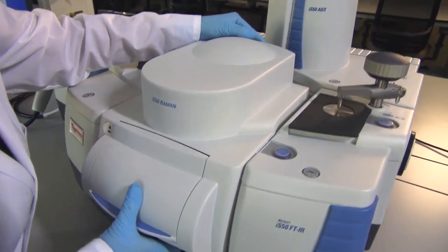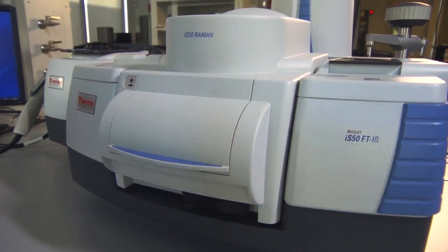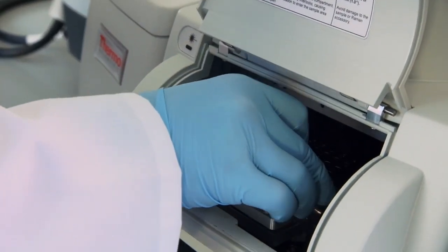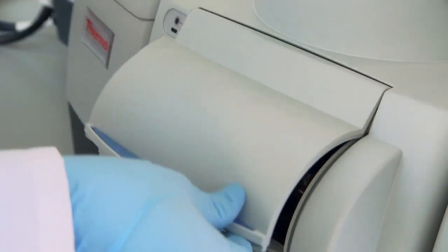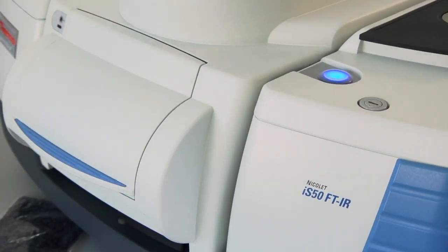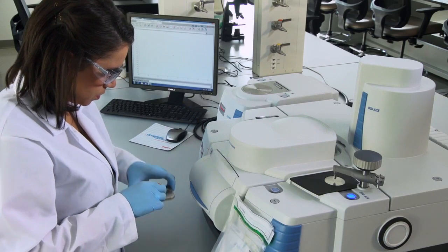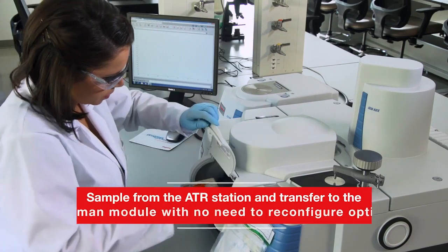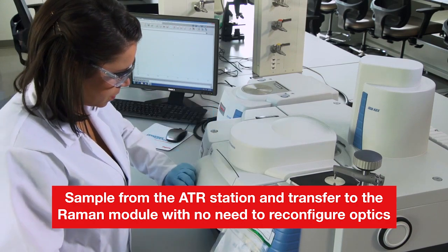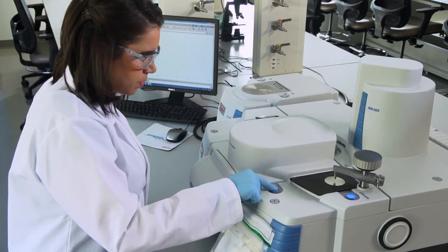Or, simply add the IS-50 Raman module to detect differences in branches of macromolecules and determine your material's crystallinity or density, all with no sample preparation. Like all IS-50 accessories, the Raman module is automatically integrated within the spectrometer, so you can sample from the ATR station and transfer to the Raman module seamlessly, with no need to reconfigure optics or wait for the system to stabilize.